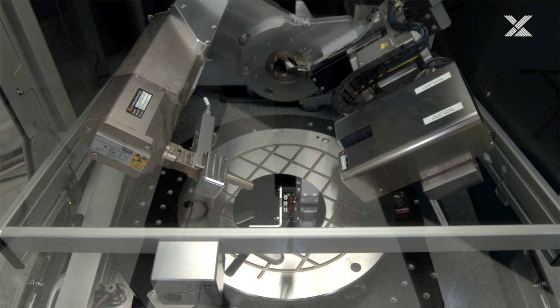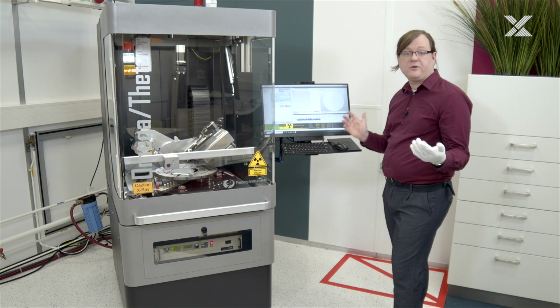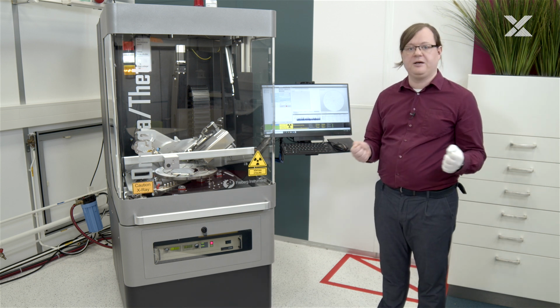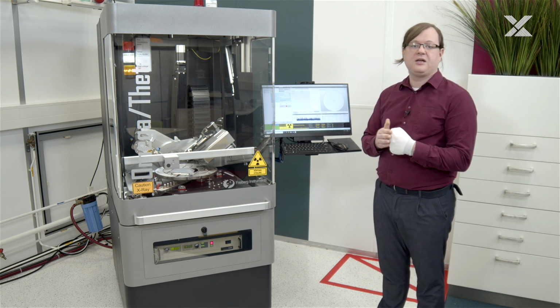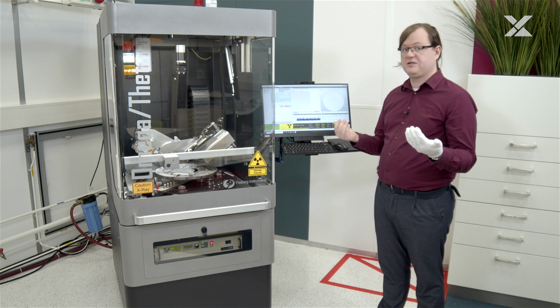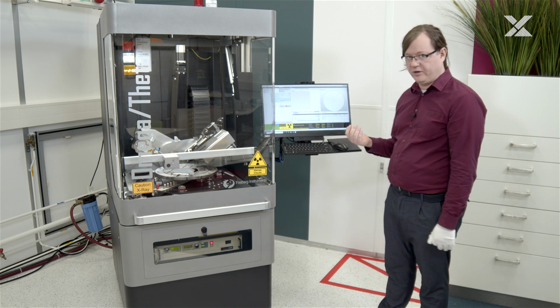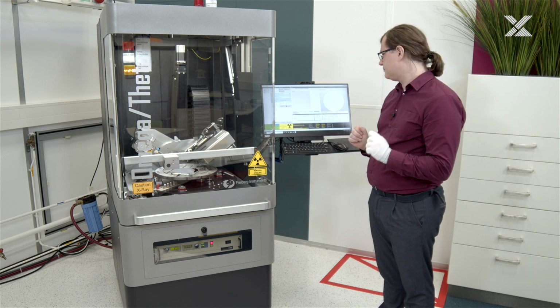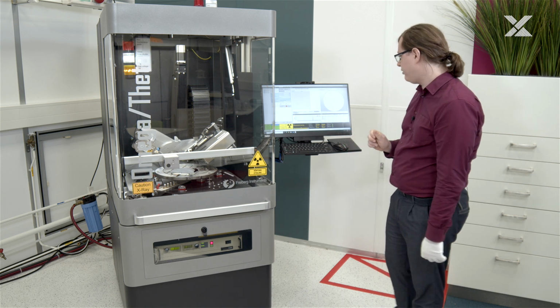Both of these scans are recorded with a monochromator inside. Without the monochromator, the optics on this system will only allow us to say something about where the peak is, but we cannot say anything about the width of the peak. And that is the critical parameter you usually want from a rocking curve, but I'll explain a bit more on that later. Now, here we see our rocking curve coming in.